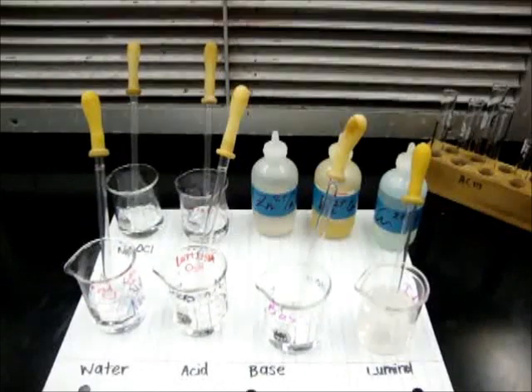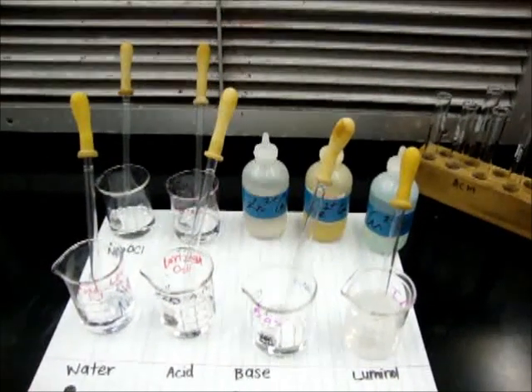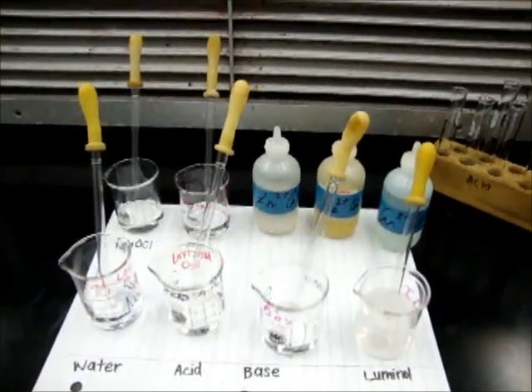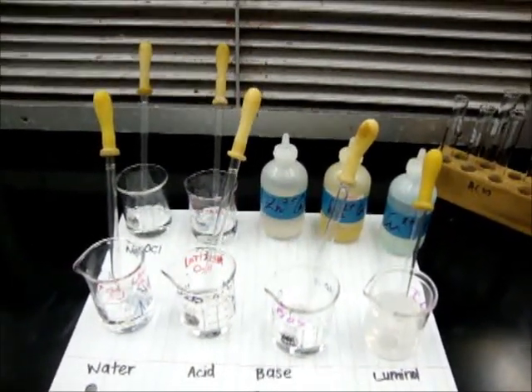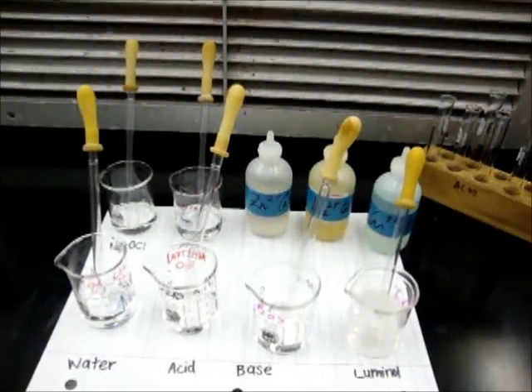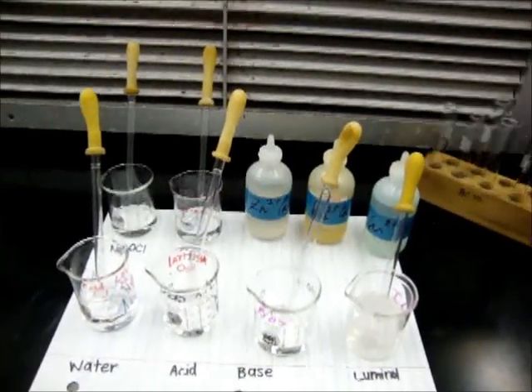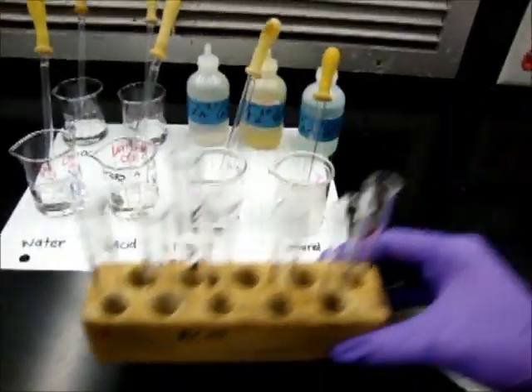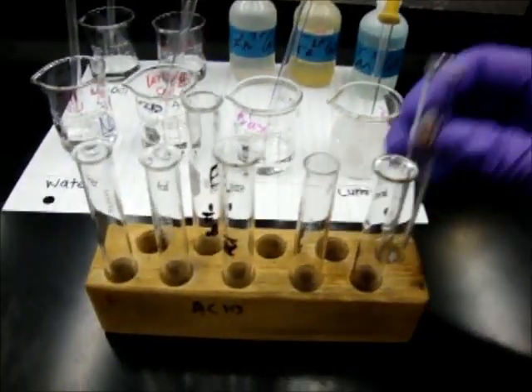You don't have to get the exact amount your lab manual specifies, but the solution shouldn't be wasted. Also, prepare several clean test tubes so that you can test your reactions.